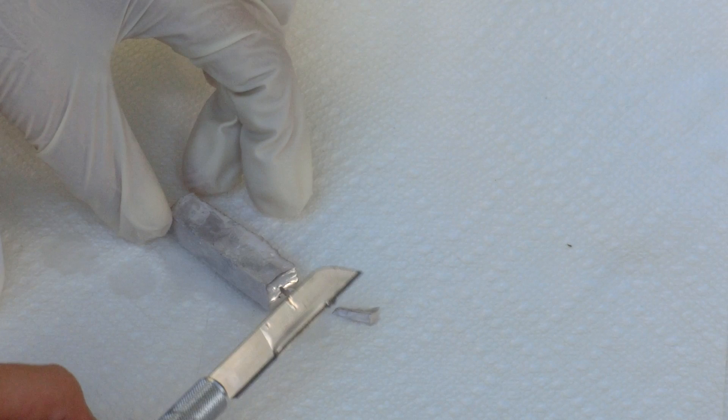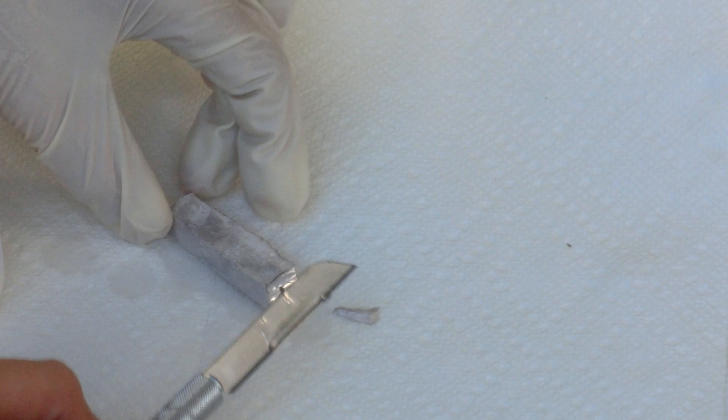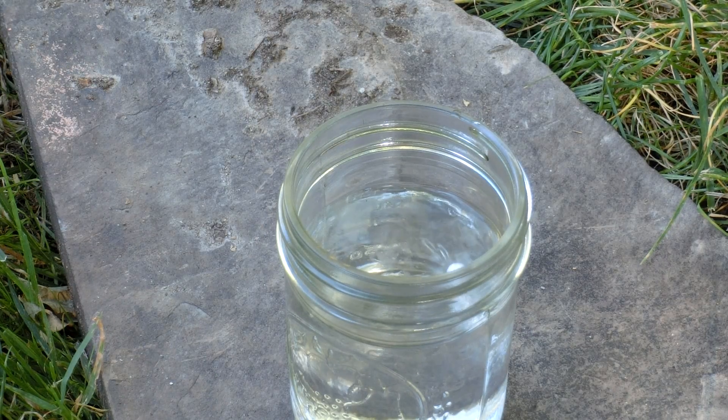Here, I cut off a small piece, just for demonstration purposes. About half of this piece will now be dropped in water.